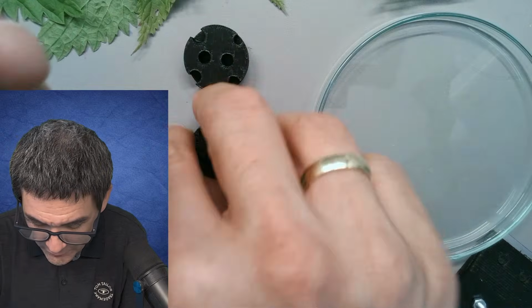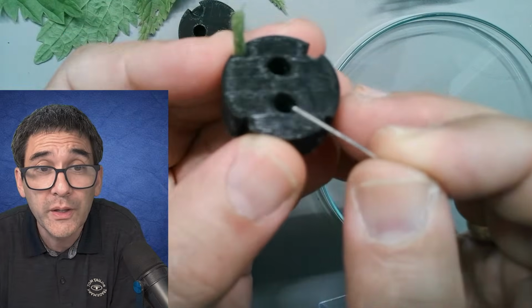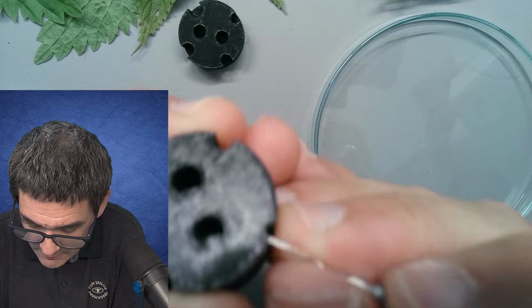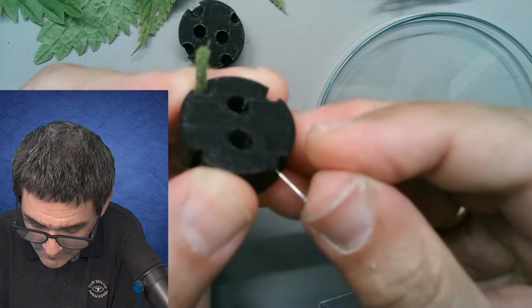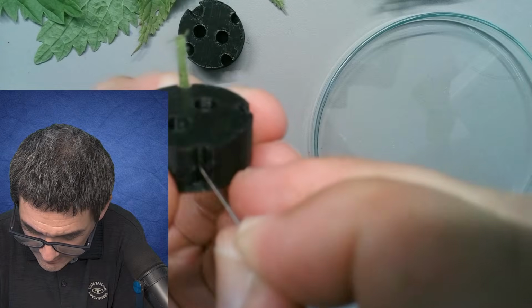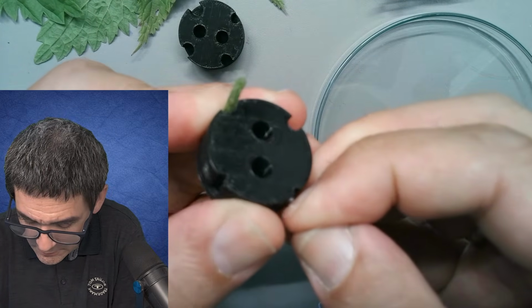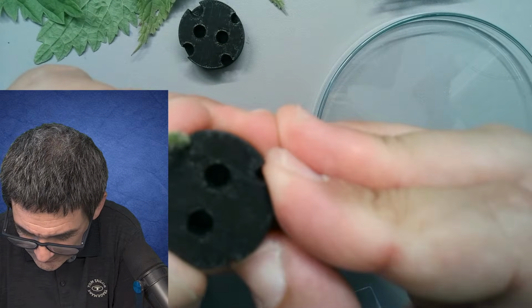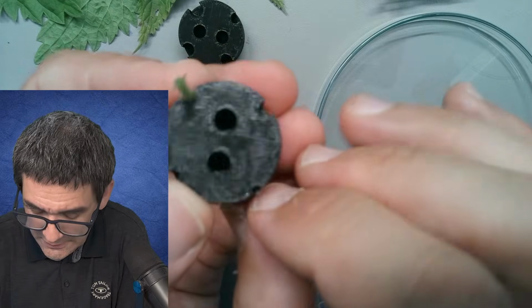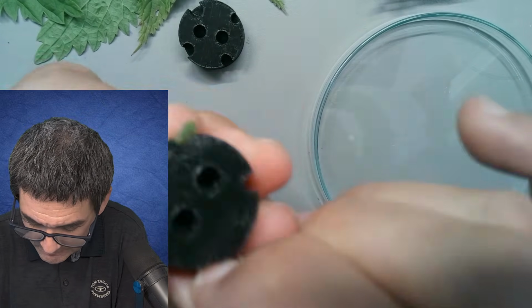And I'm going to take a pin. I'm going to push it all the way through to hold it in place. And I hope that I'm able to do that. Here we go. All the way in, all the way in. I don't know. This is a problem I just realized, because this pin head is still sticking out. This is bad.